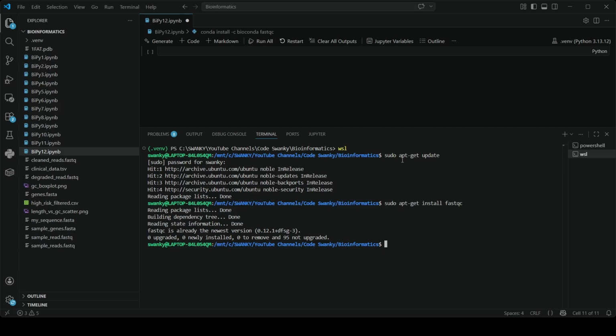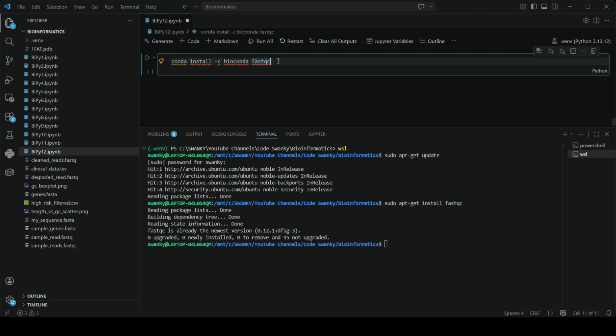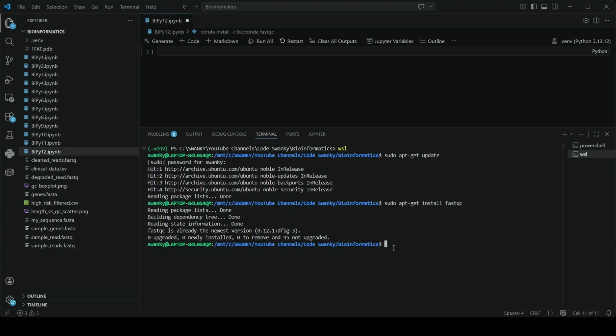And if you're using Conda, which is very common in bioinformatics, you can simply type this command over here: conda install -c bioconda fastqc. Once it is installed, we can verify it is working by checking the version. So let's check the FastQC version, and yes, FastQC has been installed. Now let's run it.